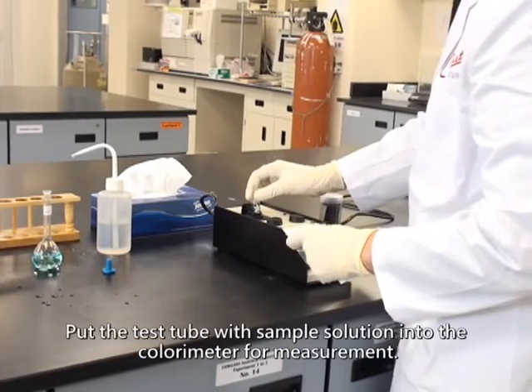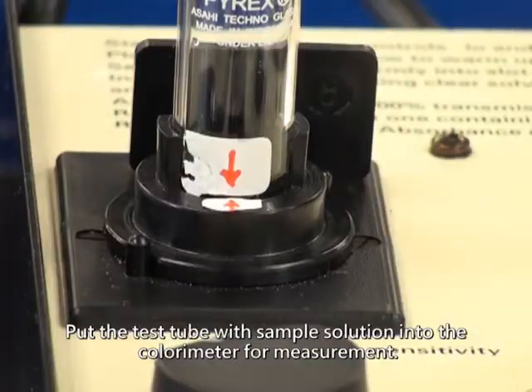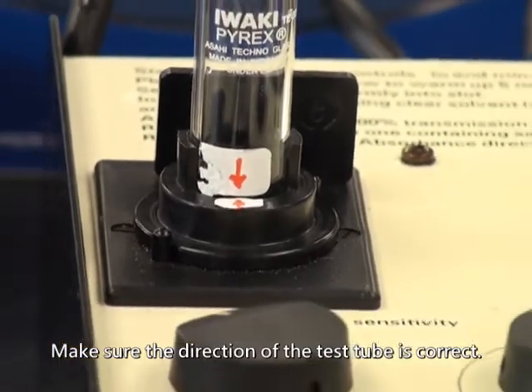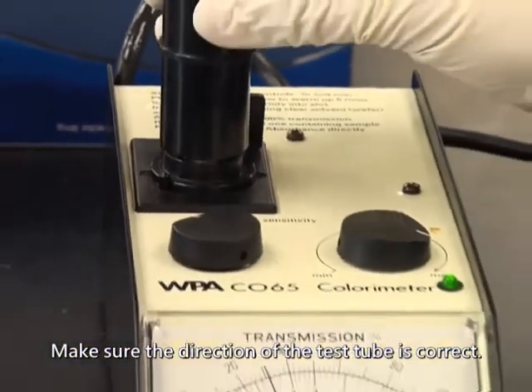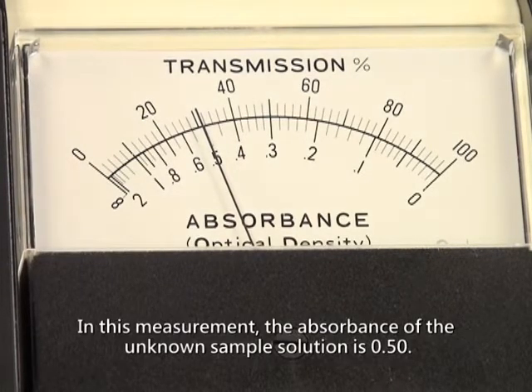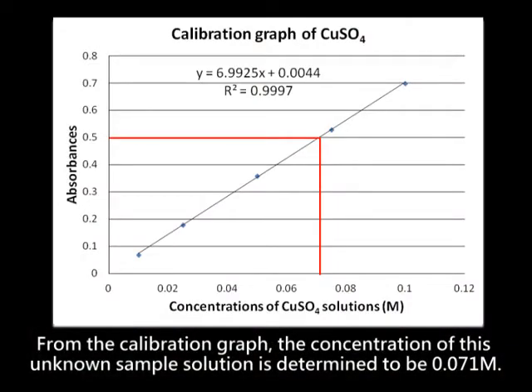Put the test tube with sample solution into the colorimeter for measurement. Make sure the direction of the test tube is correct. Record the absorbance reading. In this measurement, the absorbance of the unknown sample solution is 0.50. From the calibration graph, the concentration of this unknown sample solution is determined to be 0.071 molar.